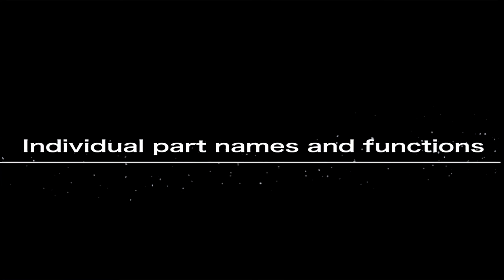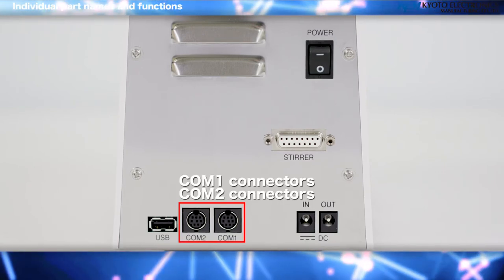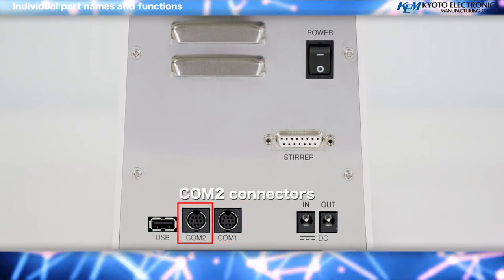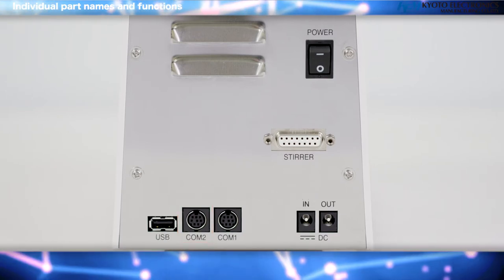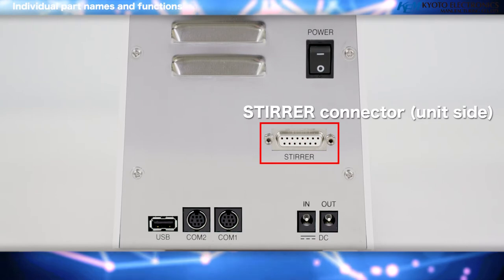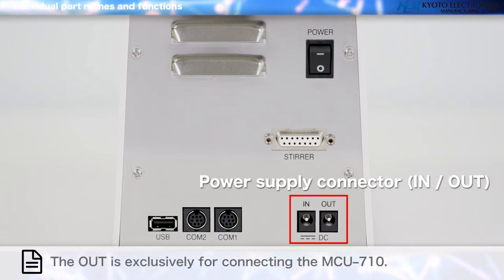Individual part names and functions: we will now provide an explanation of the name and function of each part of the MKC-710. Com-1 and Com-2 connectors: a dot matrix printer can be used by connecting it to Com-1; a Moisture Evaporator and Multiple Sample Changer can be used by connecting them to Com-2. USB Connector: the MCU-710 connects here. The Stirrer Connector on the unit side connects the Magnetic Stirrer that stirs the sample solution. The Power Cord connects to the Power Supply Connector.